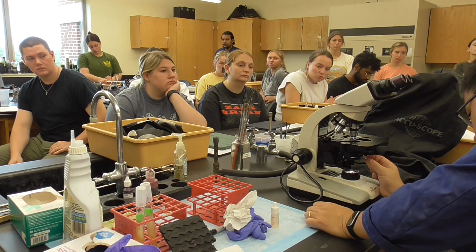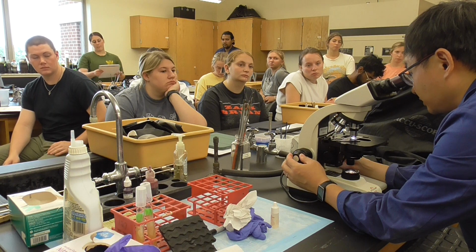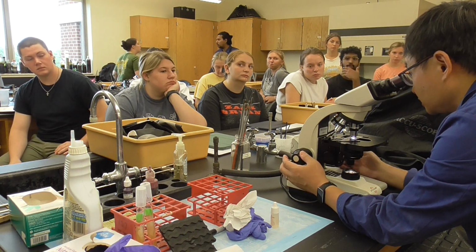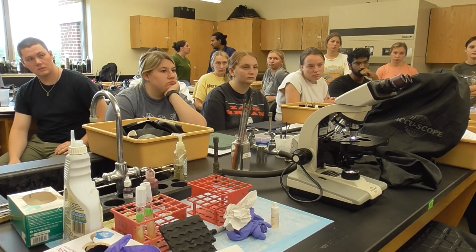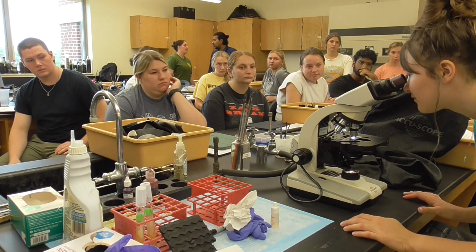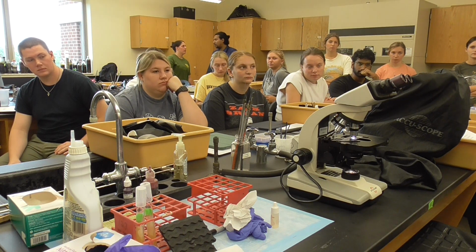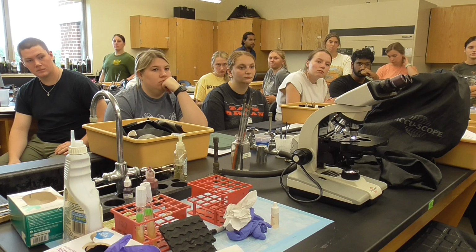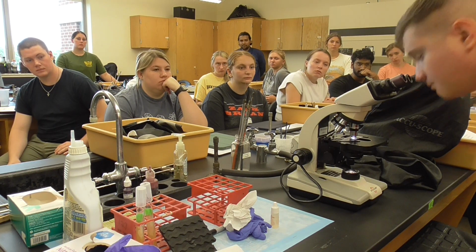okay, that looks fine to me. Then we go here, which means the iris diaphragm has to be all the way to the top. Now you can see somehow like, underneath 100x, you can see it's single, short rods for the lactobacillus. It depends whether the slant got contaminated. Sometimes you're not going to see the results. Okay, that looks fine. That looks good.